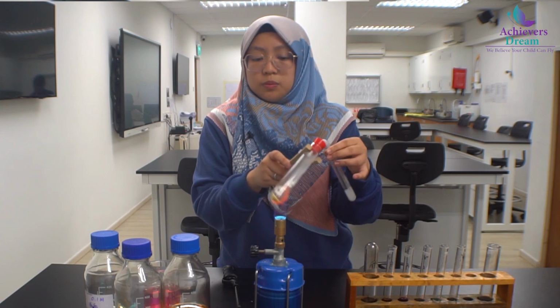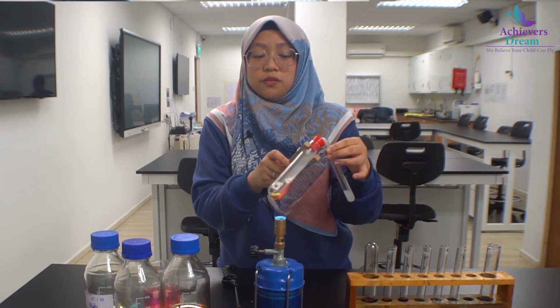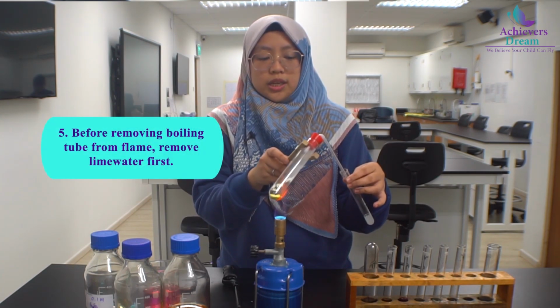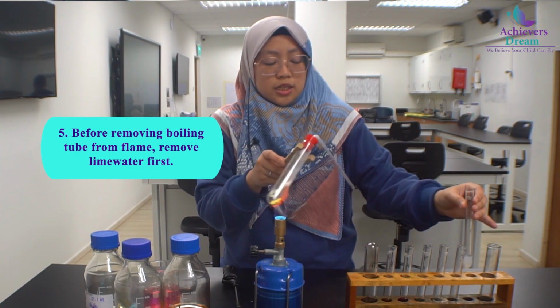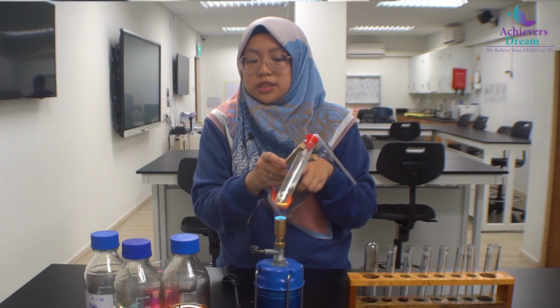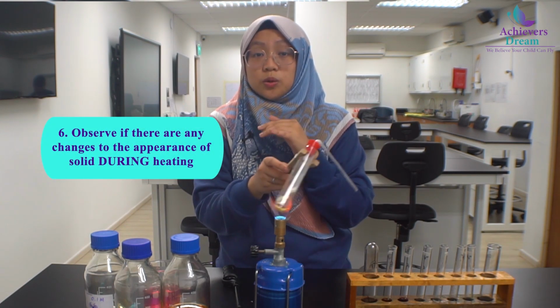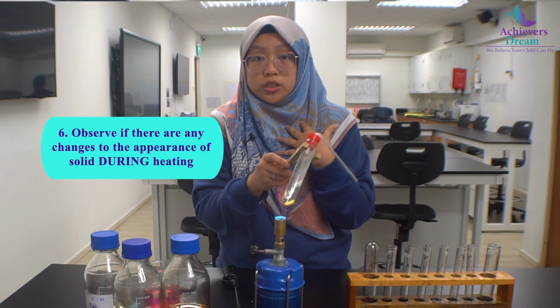Now, during heating, please be careful. When you want to remove it from the flame, you should actually remove the lime water first. This is to prevent the lime water from getting sucked back into the boiling tube. As you can also see, the appearance initially was a white solid. After heating, it has turned yellow.